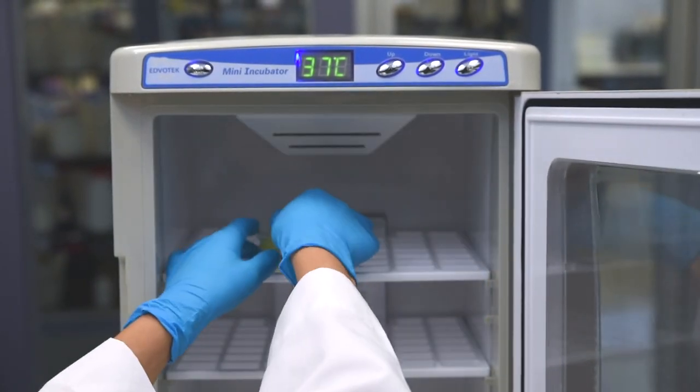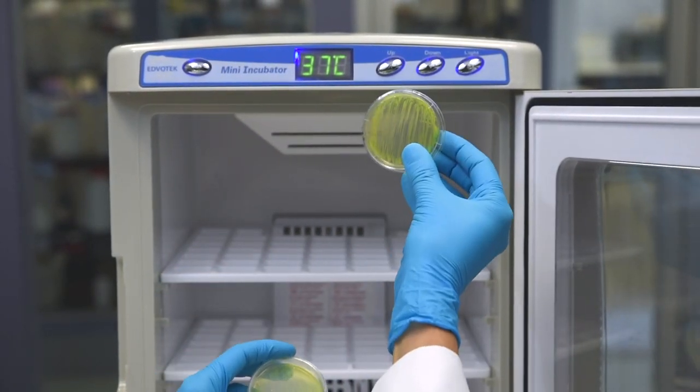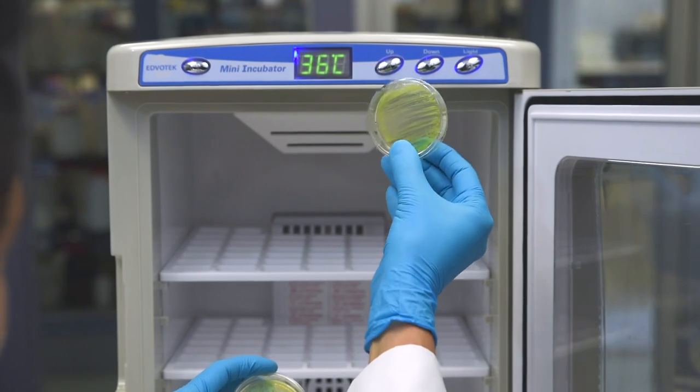Step 8: After the overnight incubation, check to make sure there is a confluent lawn of growth on at least one of the plates.